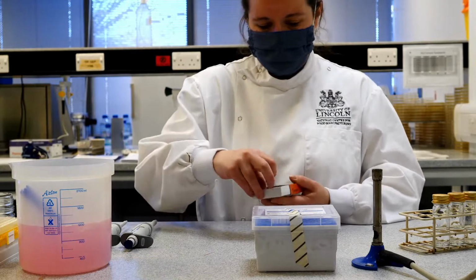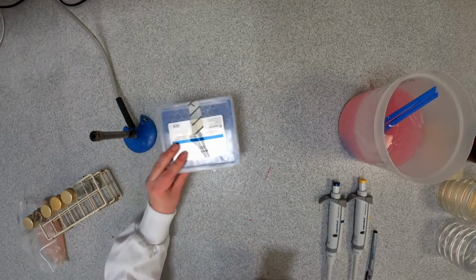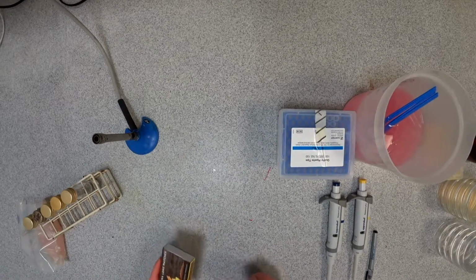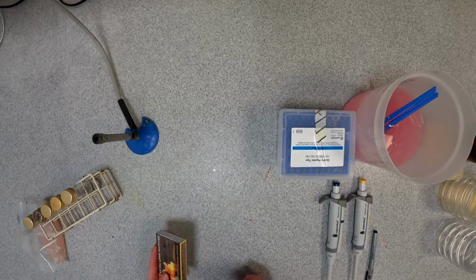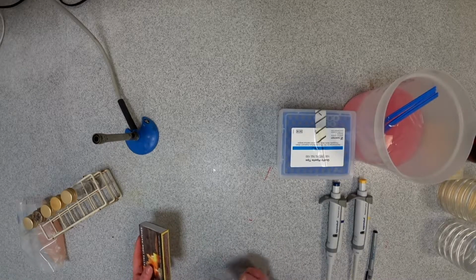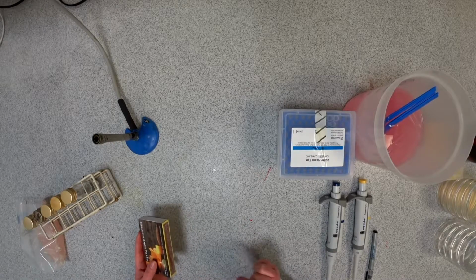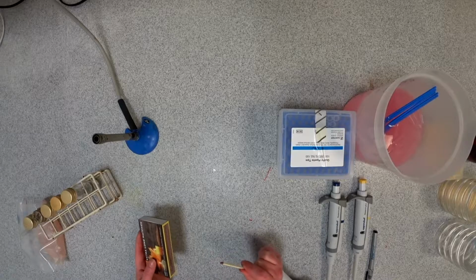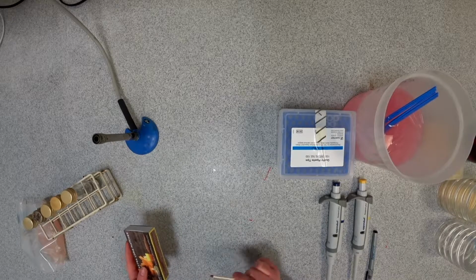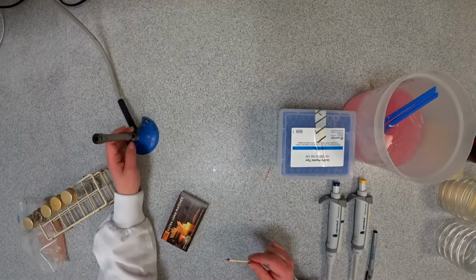First, the most important thing to do in the microbiology lab is to get our Bunsen burner going so that we've got a nice sterile environment to work with. One of the problems that we have with videoing and recording with a Bunsen burner on is that the Bunsen burner is very noisy. So although I should have it on as a roaring blue flame all the way through the process, I'm going to end up turning it up and down so that we don't have the constant noise in the background, because we don't want that to distract from what we're doing.